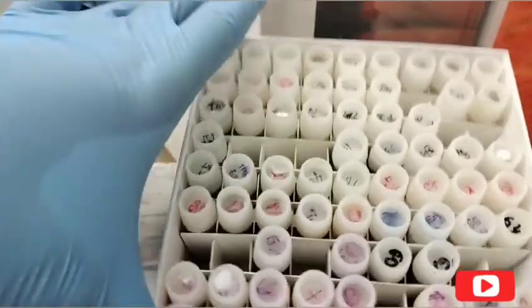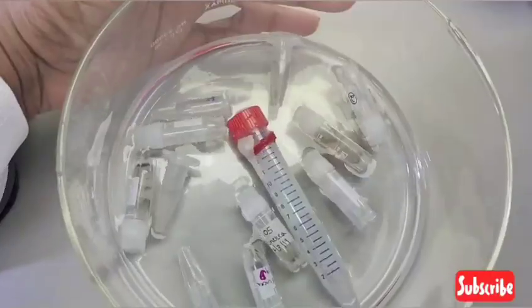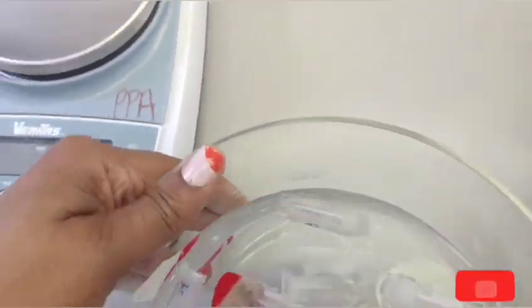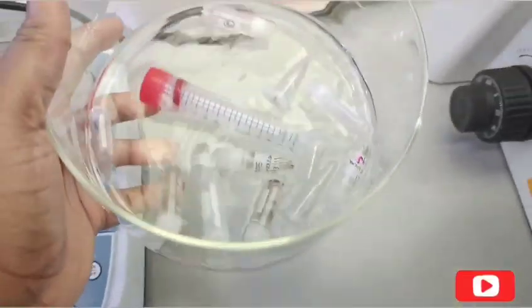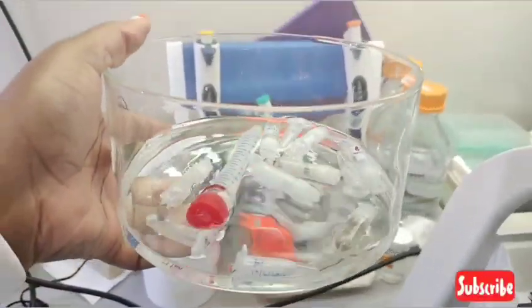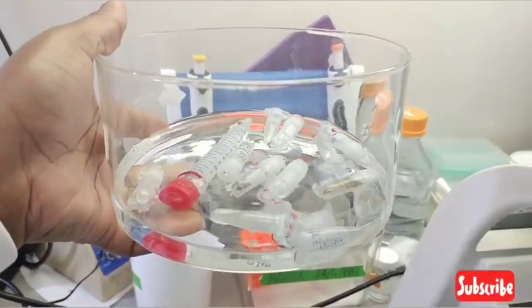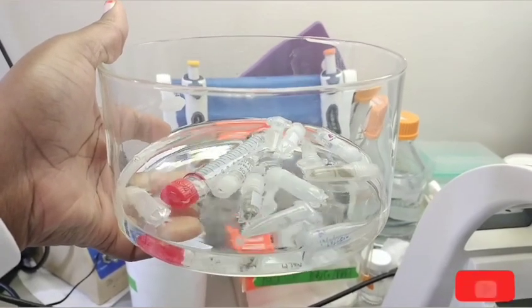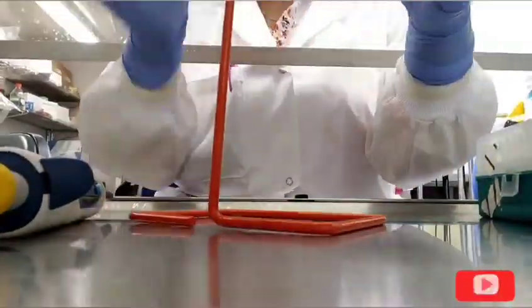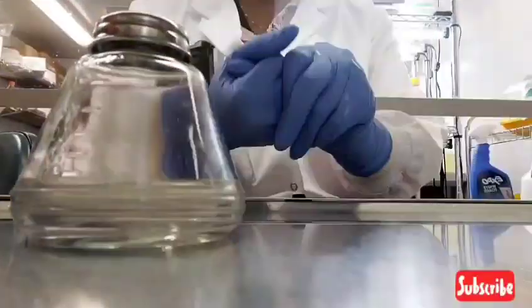Oh, yes. I put them in this little bowl of water to thaw. I think they've thawed, so I'm going to go subculture them, which is just placing a piece of it onto agar plates. I'm setting up my waste bag, then I'll sterilize my tools.